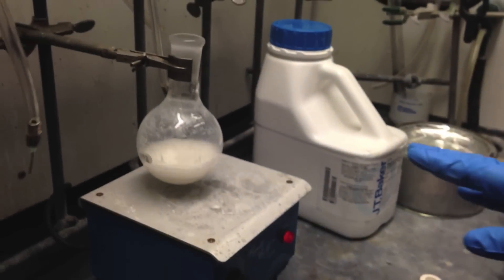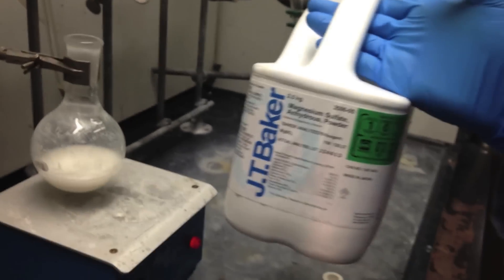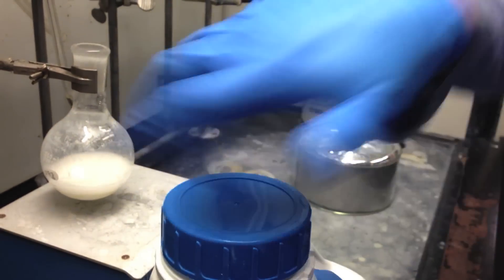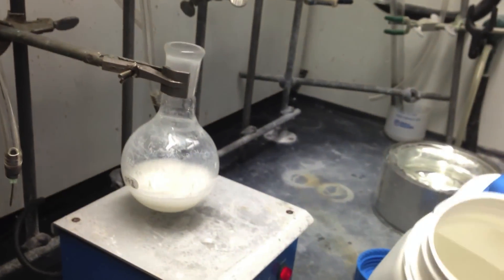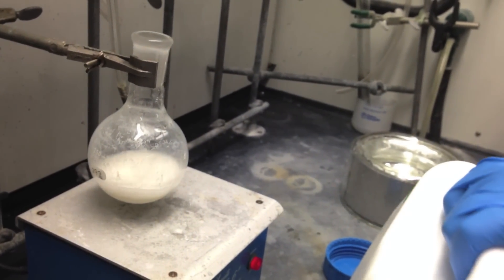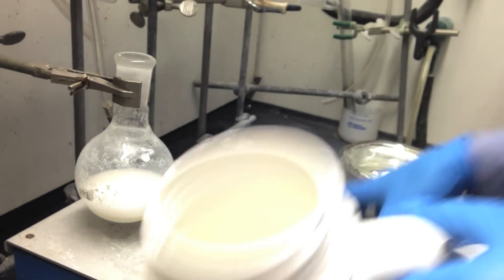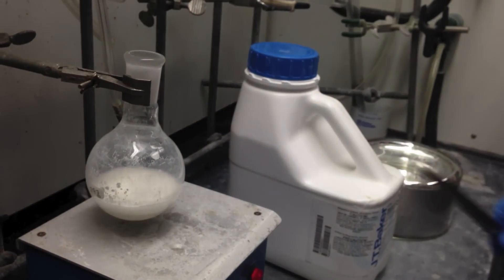We just added some water to this reaction mixture and we don't want that in the final product. So what I'm going to do is convert the water into a solid form, which will allow me to filter it away. Magnesium sulfate is a dehydrating agent — it will soak up all the water to form the magnesium-water complex, and then we'll be able to filter away the solids. I'm adding the magnesium sulfate now, and I'm going to add quite a bit. We'll let that stir for about fifteen minutes to make sure all the water is removed.